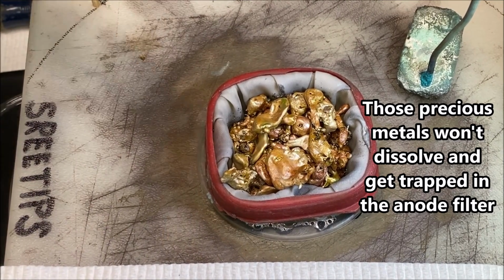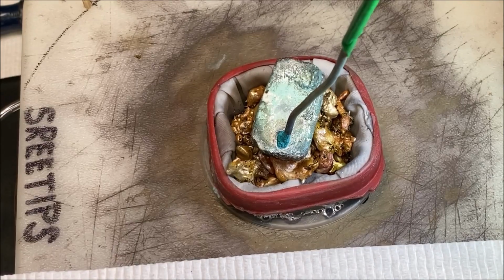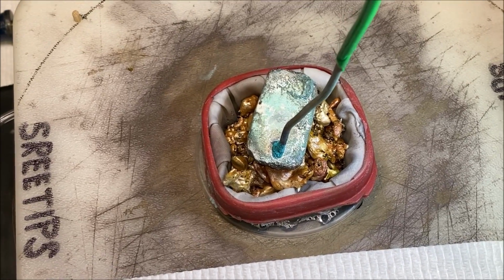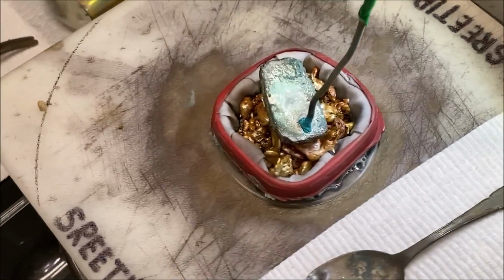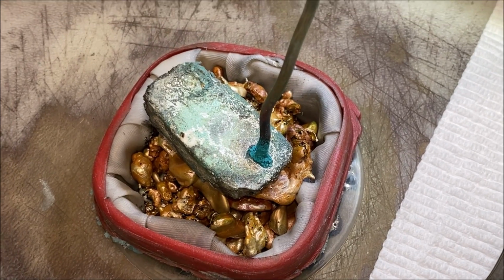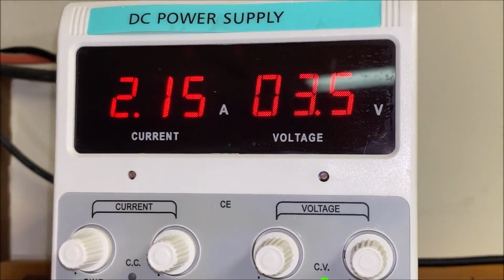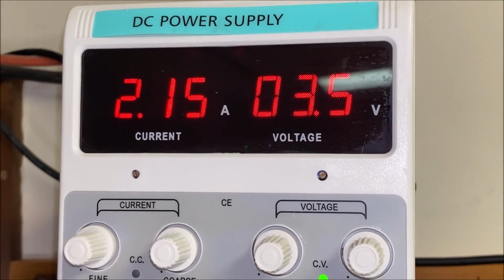Get this anode bar on there. Alright, we've got the anode filter full of impure shot, and I'll top that off again this evening before I go in and go to sleep. Here are the readings on the power supply.